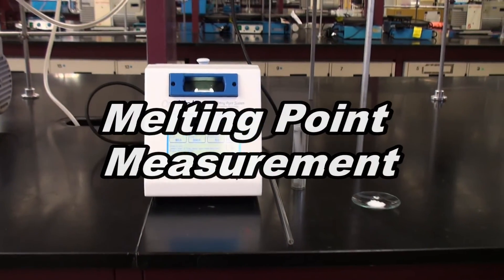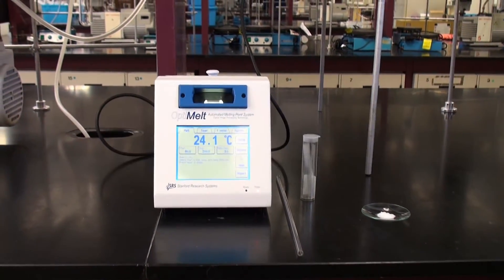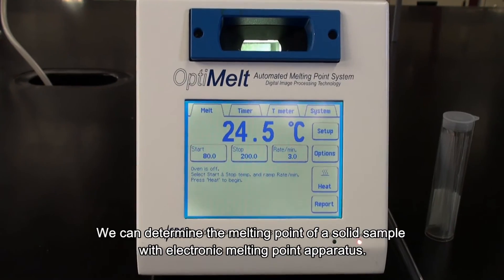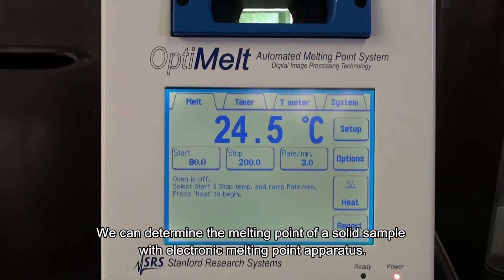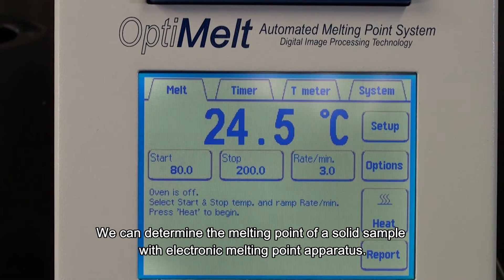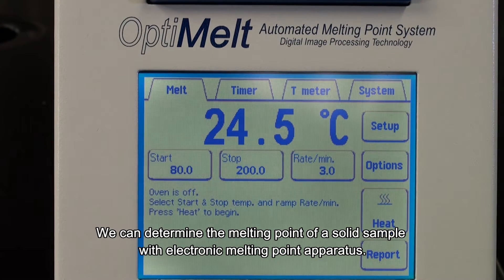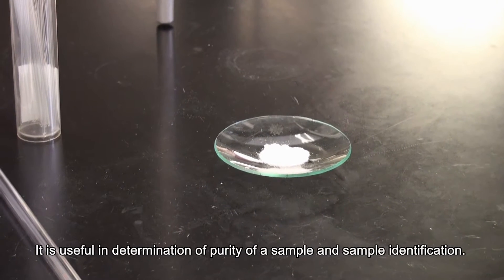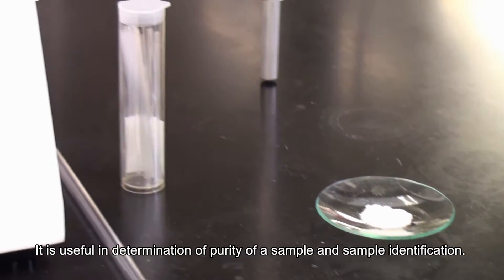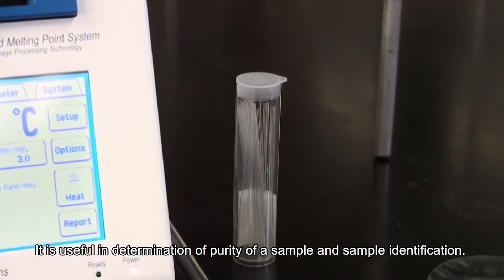Melting point measurement. We can determine the melting point of a solid sample with an electronic melting point apparatus. It is useful in determination of purity of a sample and sample identification.